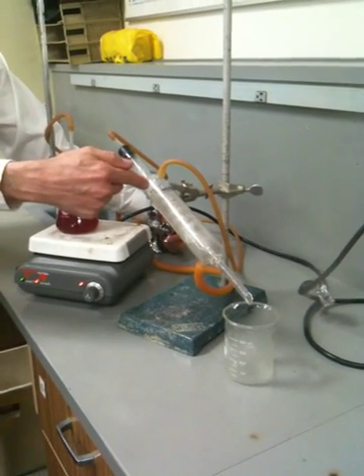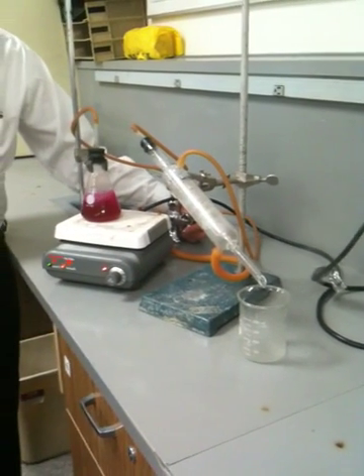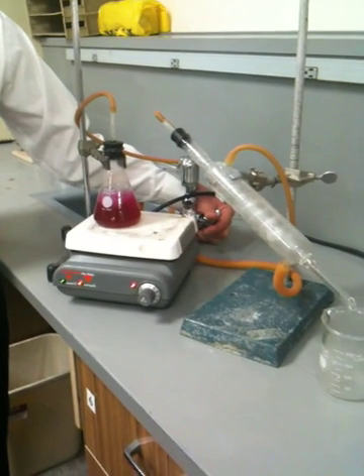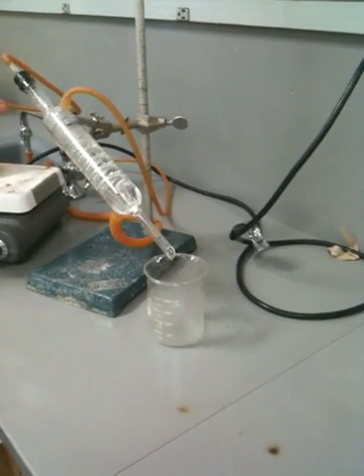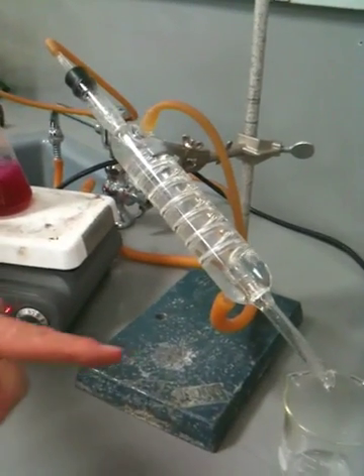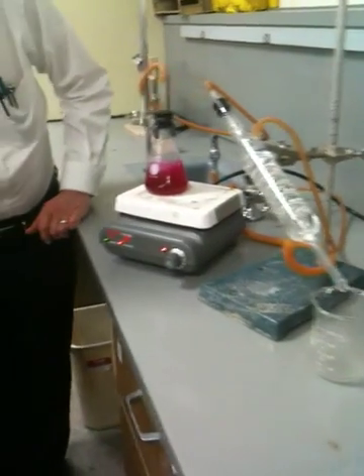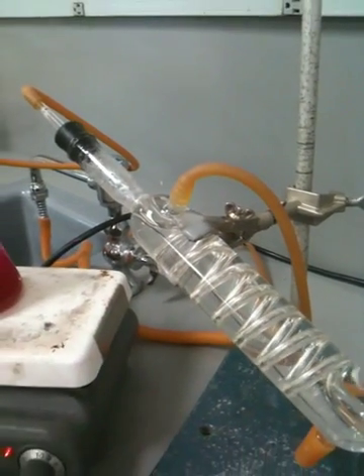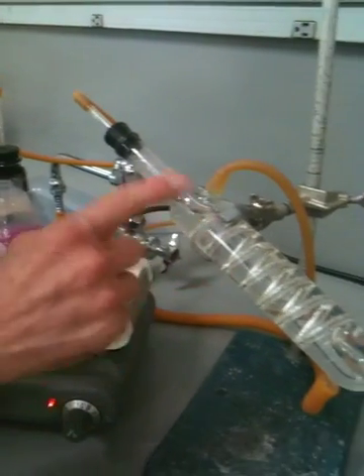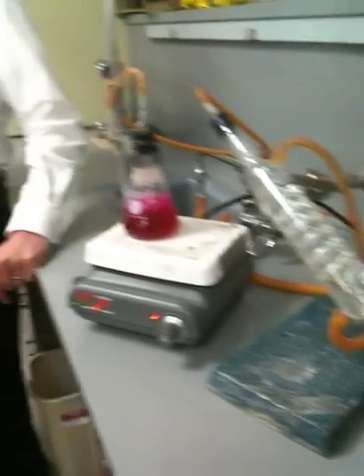As soon as I turn the water on, it will cool this down. Condensation is going to start further up, which means the steam is going to stop coming and the dripping is going to stop. See that going up? And now — the steam is gone and the dripping has stopped. You'll be able to see the water is just kind of moving its way around through the spiral section here. And when it gets full, we'll start to see water dripping here, but we won't see water going up into the air.